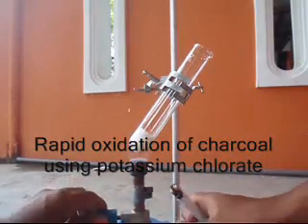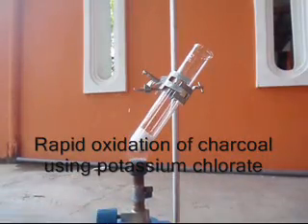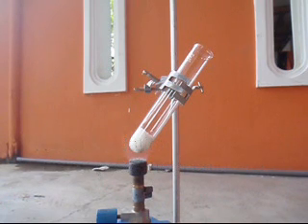Hello viewers! In this video, I will show you a rapid oxidation of charcoal using potassium chlorate.